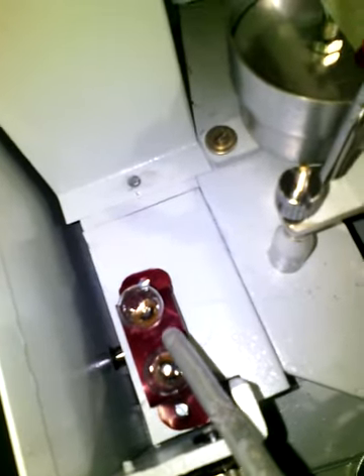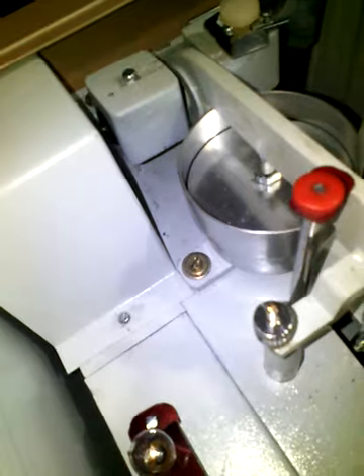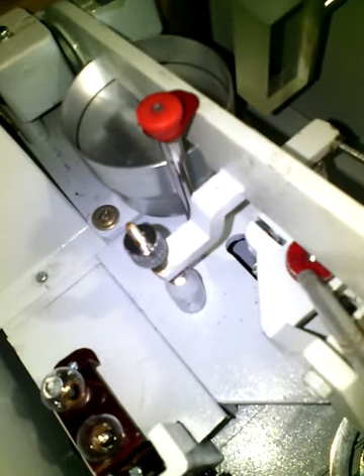There is a long cylindrical shaped covering where we will find a bulb present inside it. This small glass material is called the rough zero adjustment screw. And this is called the focusing screw. We also have two extra bulbs provided with it. We also have two red shaped locks, which we will use further for operating the balance.